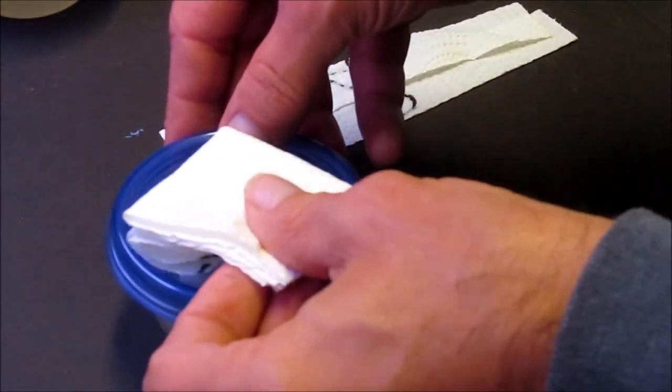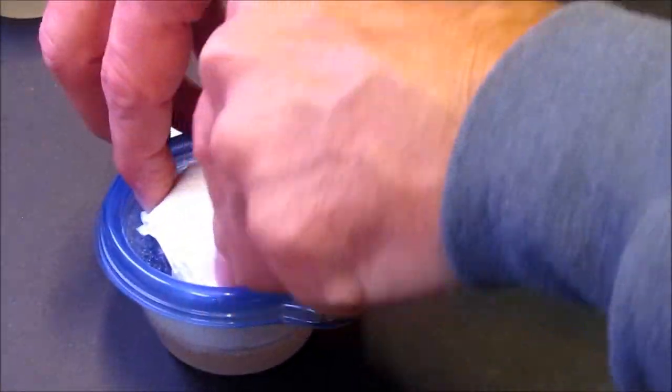Should fit right there on the top of your Glad mini round like a happy little home, happy with a paper towel right now.